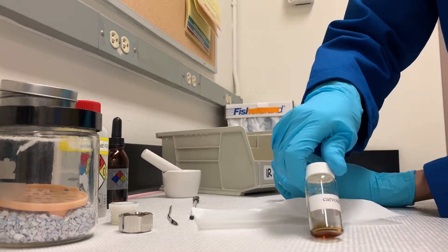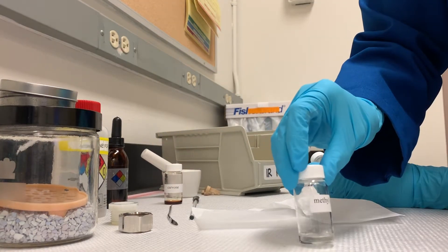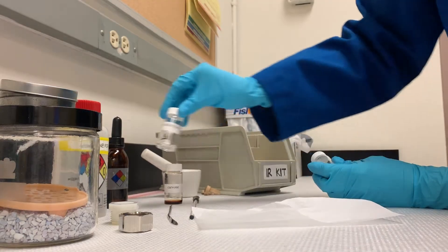It's usually the first one that we start with, it's a liquid. We also have methyl salicylate, wintergreen oil, another liquid, easy.